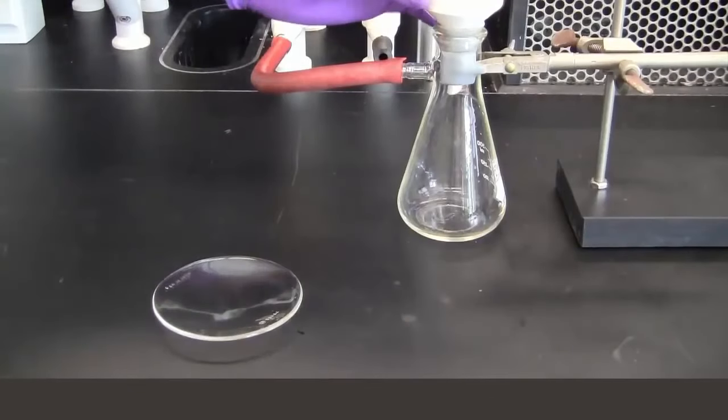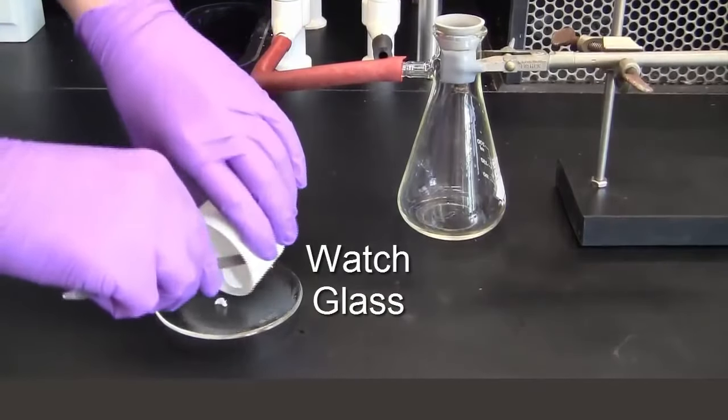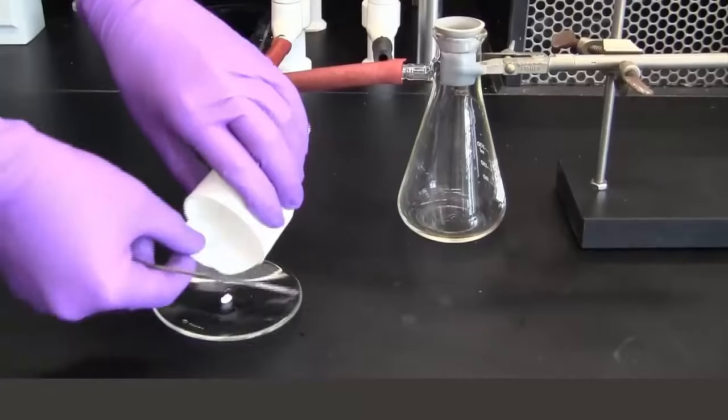To recover the solid, invert the Buchner funnel over a watch glass and remove the filter paper from the funnel using a spatula.